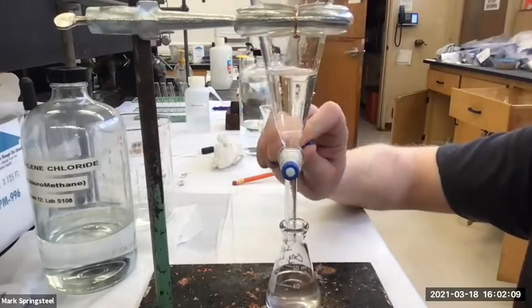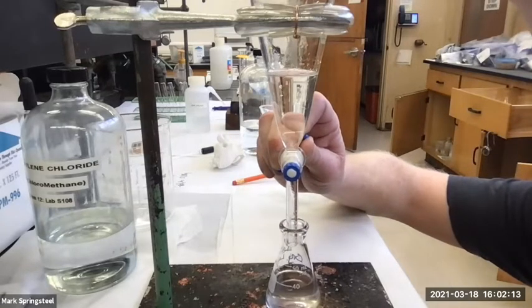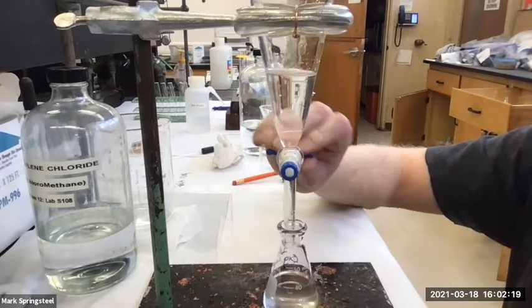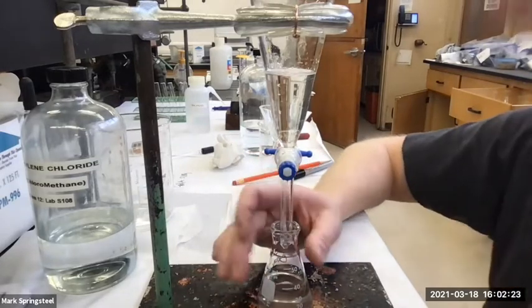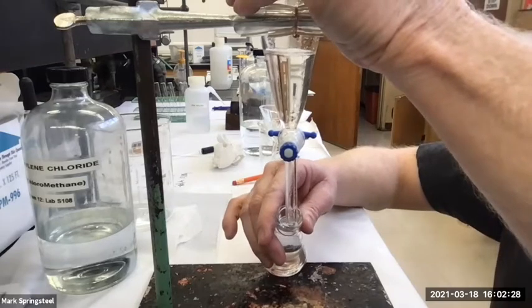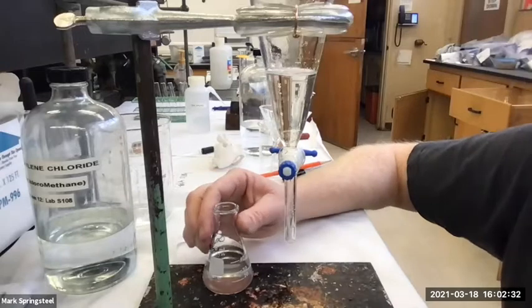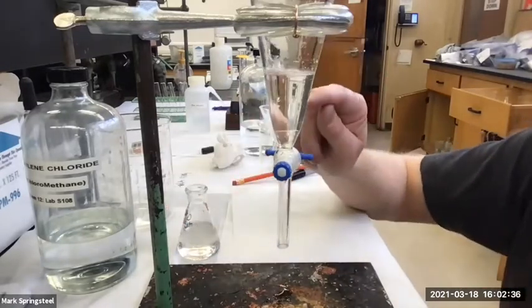And then I'm gonna drain some more, and I'm gonna try to get it separated well, but it won't be perfect, but it's okay. I'm actually gonna err on the side of adding just a little bit of water to the organic layer. Okay, so I've got them separated. So in this layer, the organic layer, I should have my neutral compounds, the dibromobenzene, and maybe benzoic acid or one of the acids if it wasn't an amine. Up here, I might have an amine, huh?